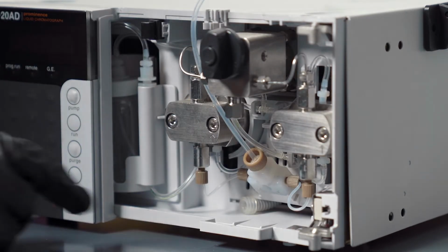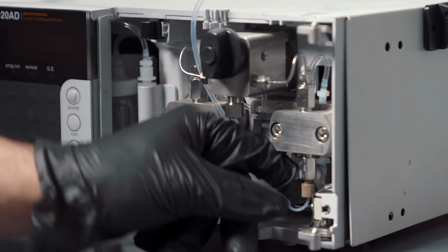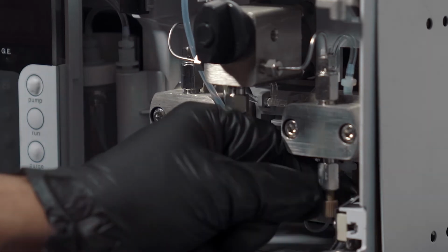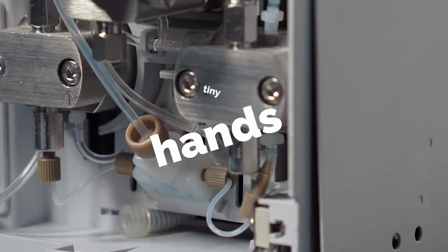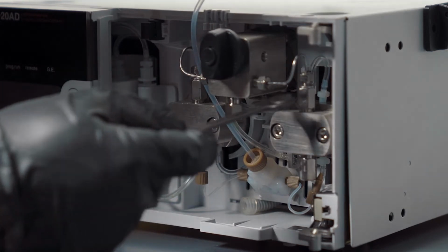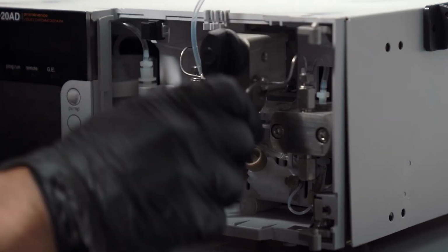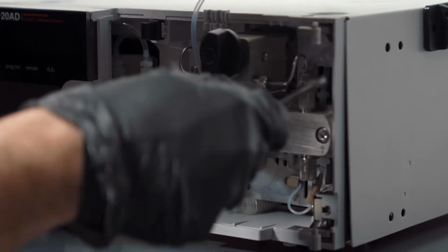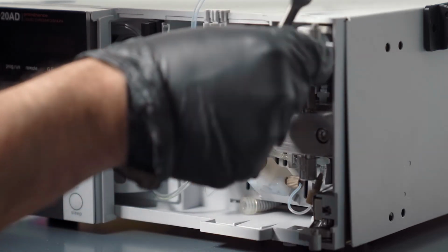So when you have issues with the check valves, the first thing you want to do to replace them is unscrew here. This is finger tight, no tools necessary here. You need little tiny hands to work on these things. People are kind of inclined to take the check valve off from here immediately or just unscrew here and here. I'm telling you, that's a mistake. So you want to unscrew from here. And then you also want to unscrew from here.